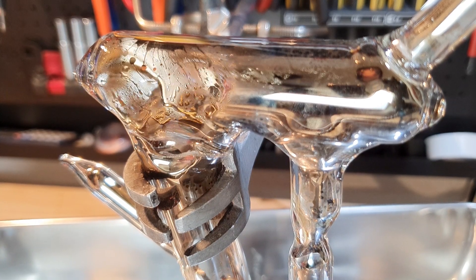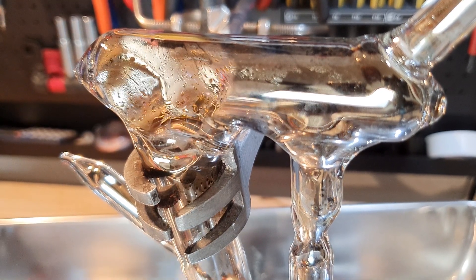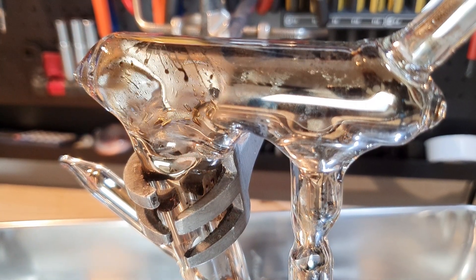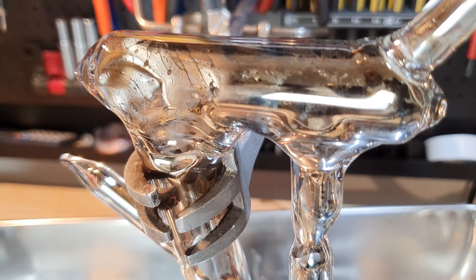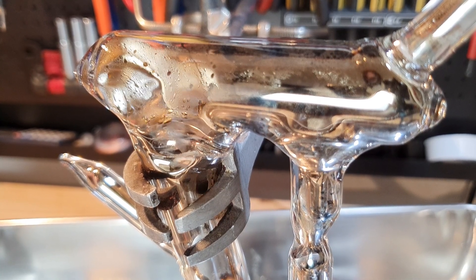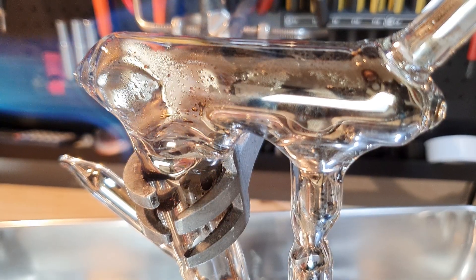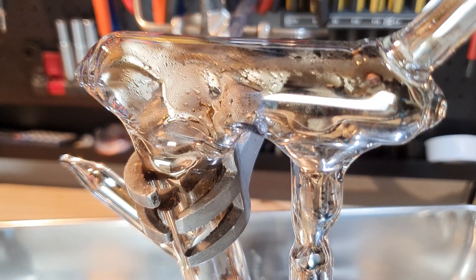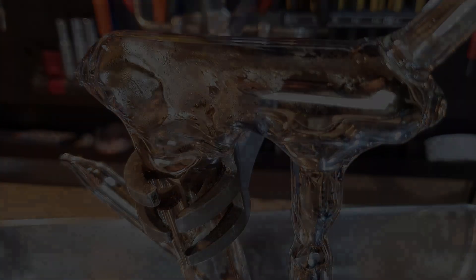I think this compound sounds really interesting. I never saw a video about it and, as far as I know, nobody has ever done it outside of a lab before — and I think those are two very good reasons to try it myself. This try was only a proof of concept to see if my apparatus would work. I will use the things I am learning in this run to improve the procedure for another try.